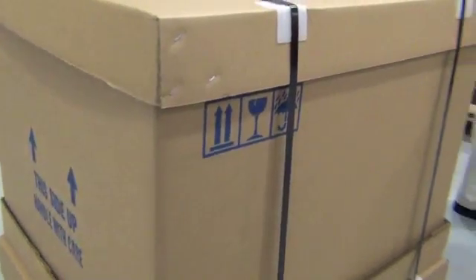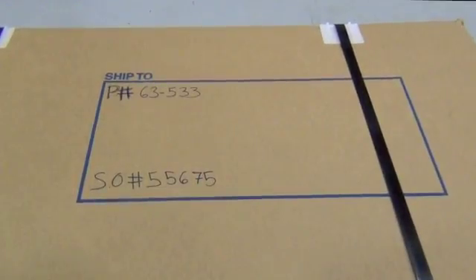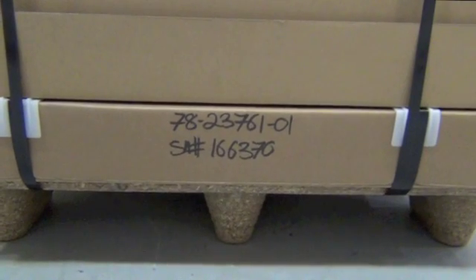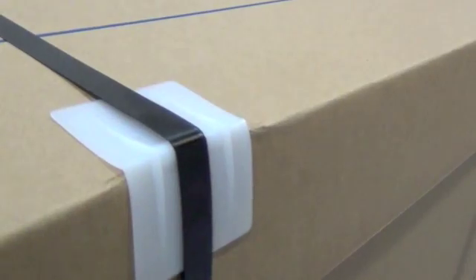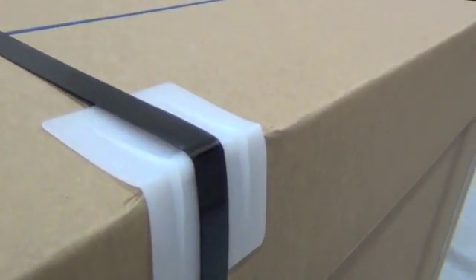These tables come packed inside large cardboard boxes with steel strapping. The top is packed at the bottom, which makes the system more stable for trucking. The complete table system weighs 500 to 700 pounds depending upon size.